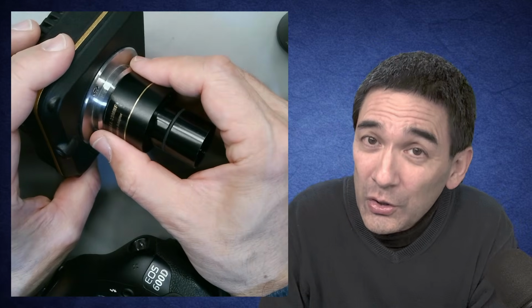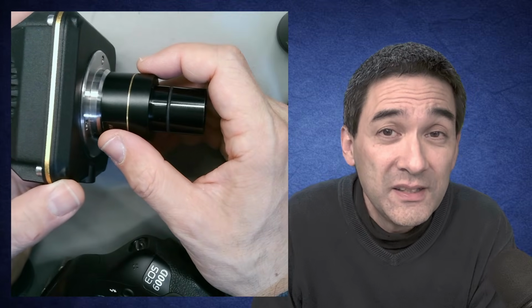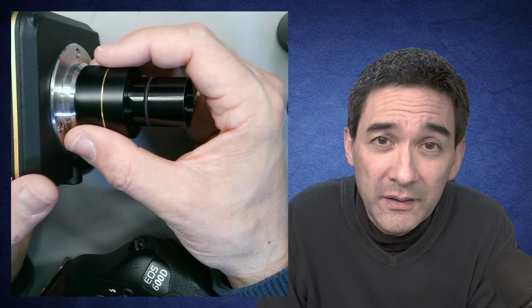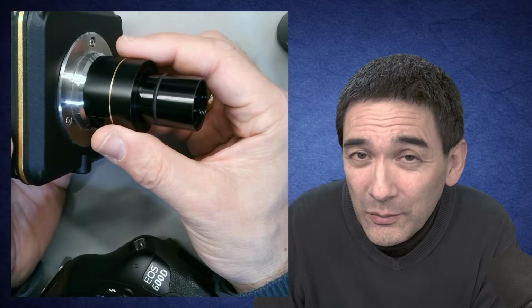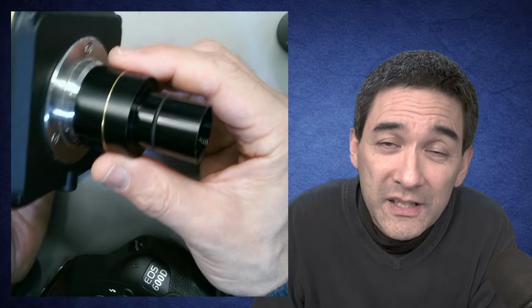There is, however, also another important reason why you have those intermediate optics, and this is referred to as parfocality. This basically means that when the optics are properly adjusted and you insert the camera into the photo tube of the microscope, then when the eyepieces are in focus, the camera is also mostly in focus.